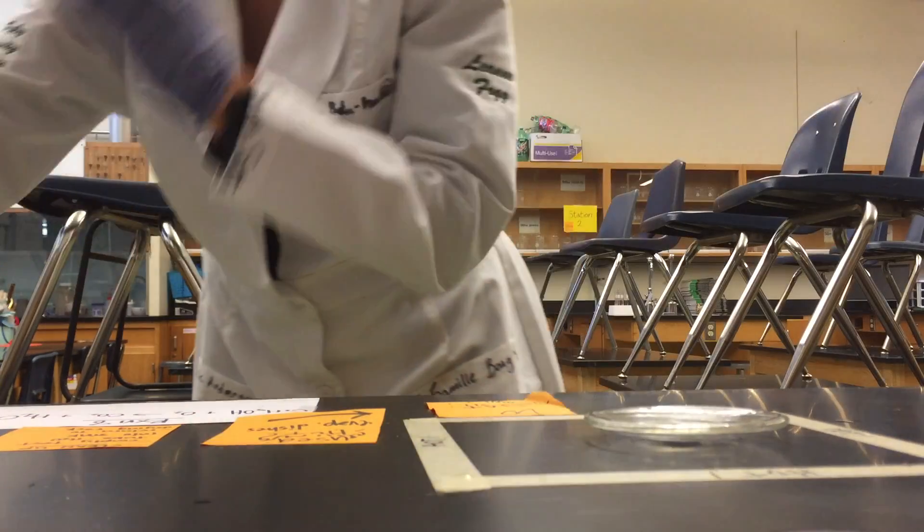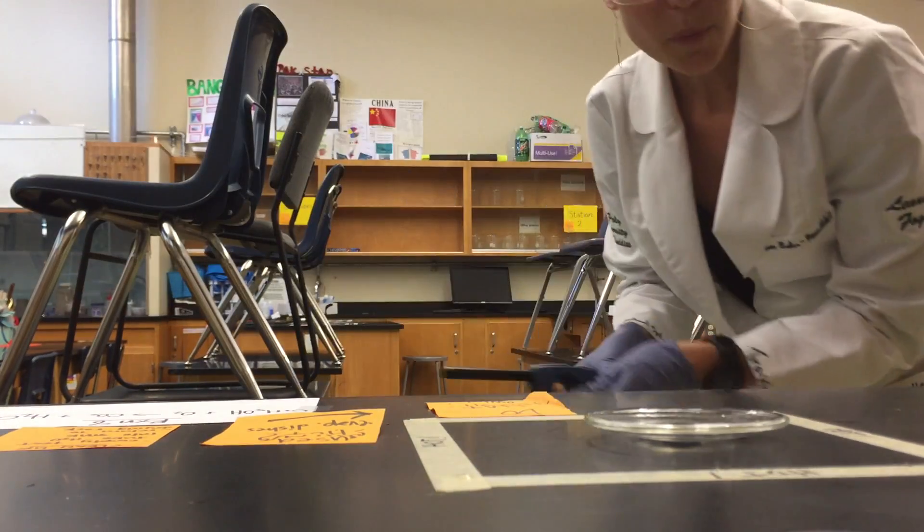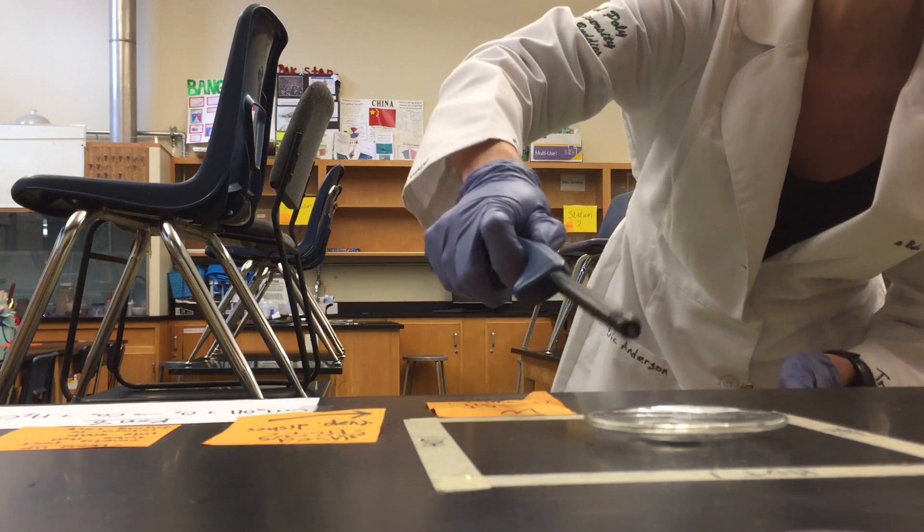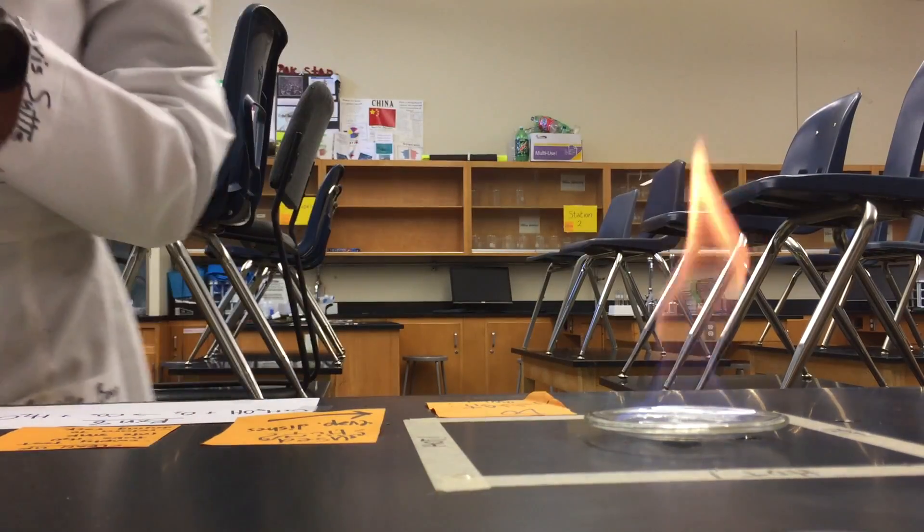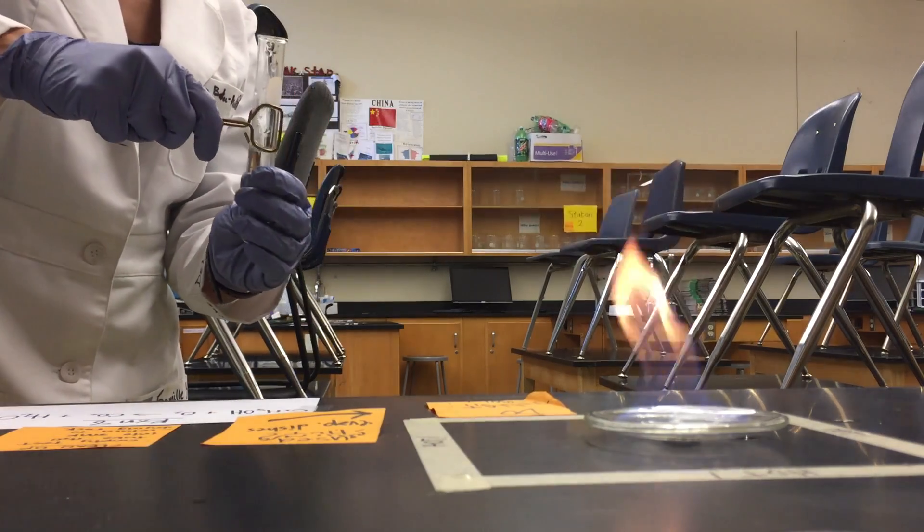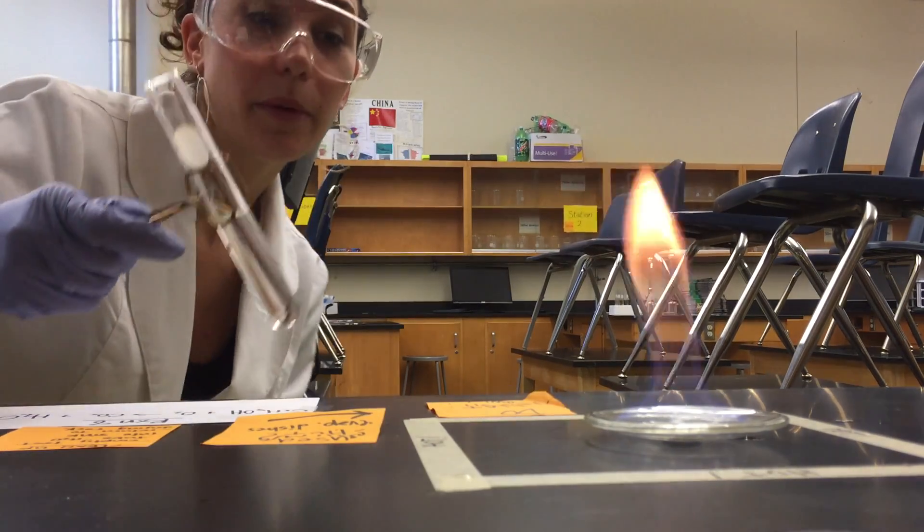So that we can see our two products, carbon dioxide and water, form. I'm going to light this up. Beautiful, and now I'm just going to hold a test tube over this flame.